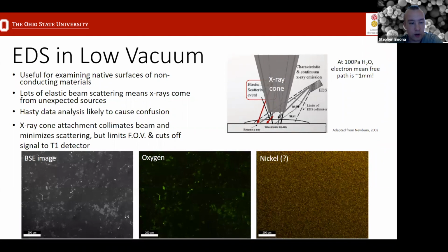To drive this point home, here's another spot where low vacuum EDS shows in the backscattered image, we have some features of different grayscale intensity. This oxygen map makes sense. There's features that correlate with what you see here. So this is useful qualitative information, but you don't really need a PhD in material science to realize that one of these things is not like the others.